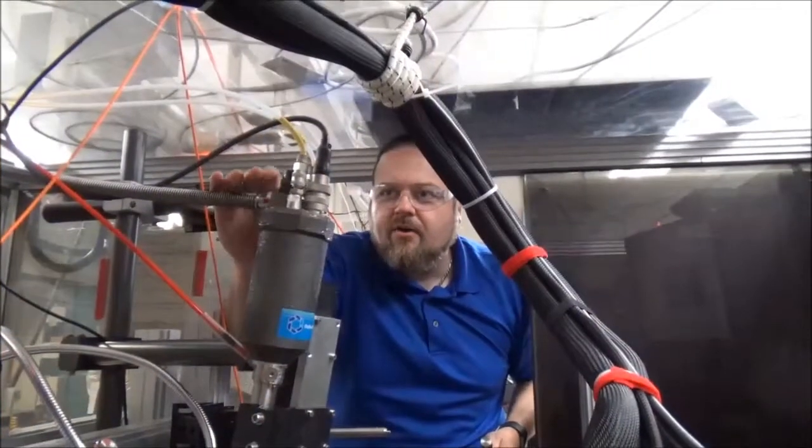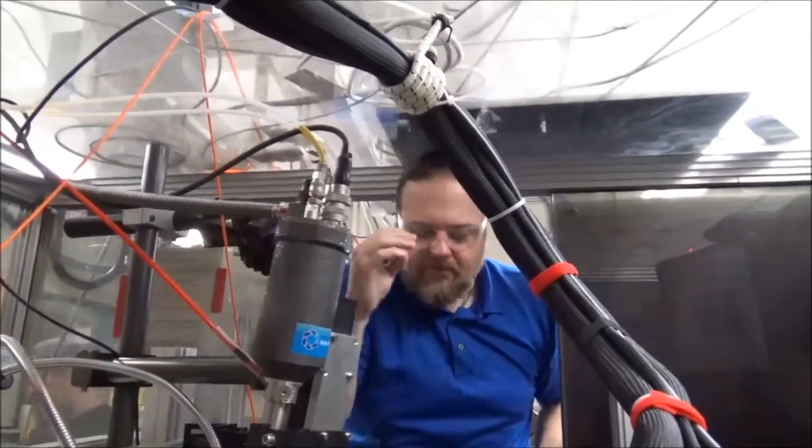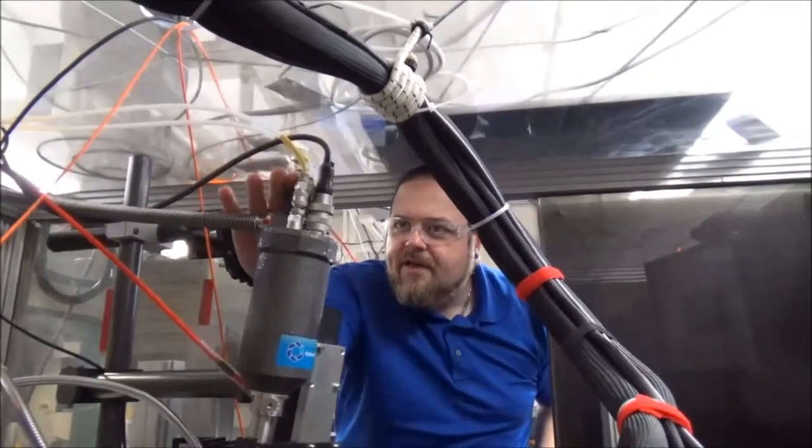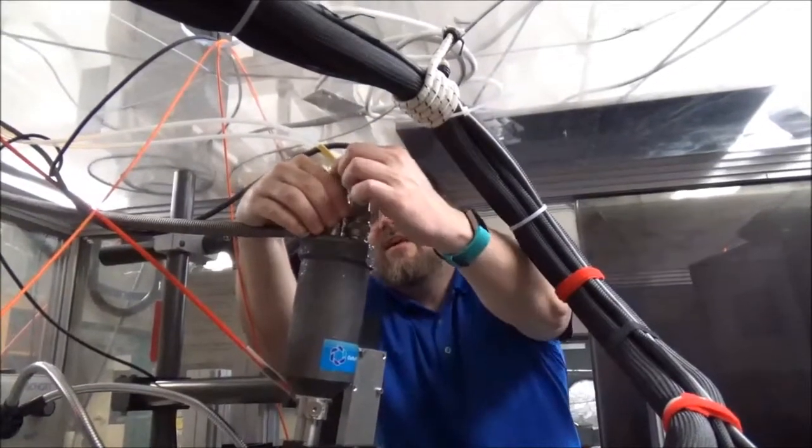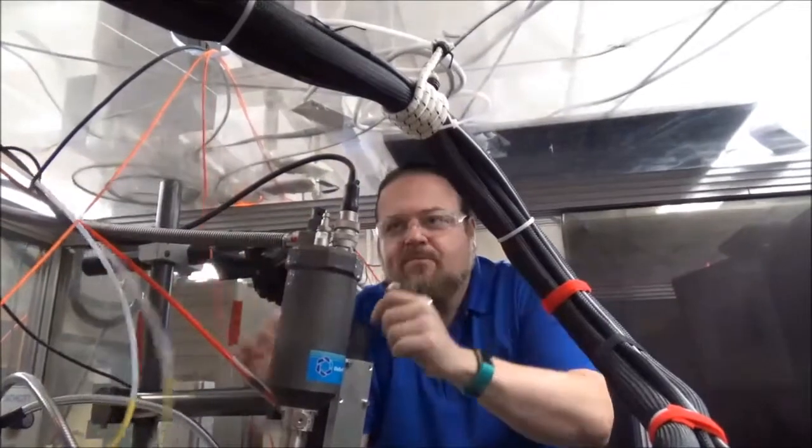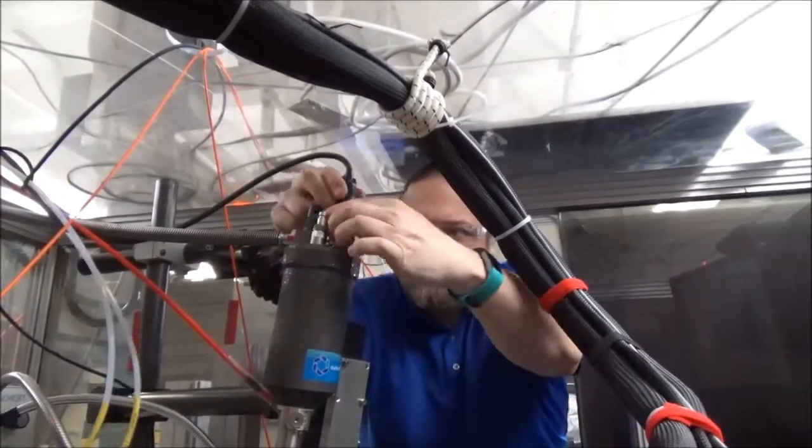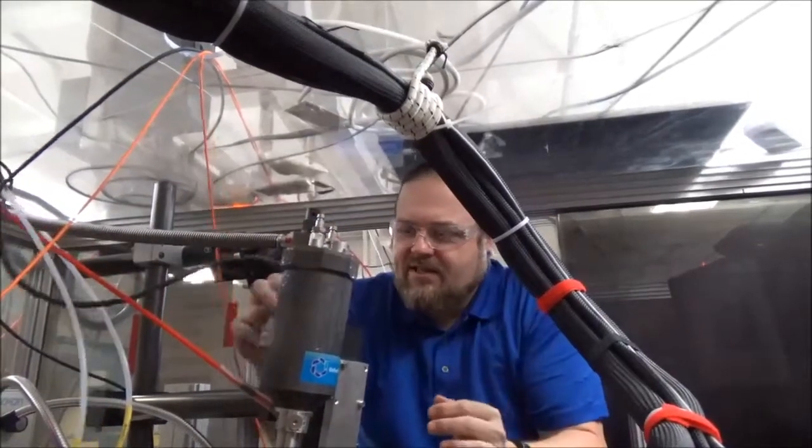Okay, so here we go. Again, it's quite wet here. We've turned off the cryo, and what we're going to do is basically disconnect these two cables here. One, two. We need to undo this electrical connector, and this just screws off. There we go, right at the base like that.